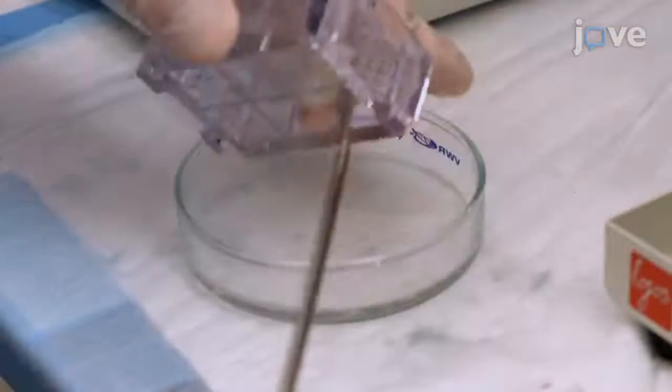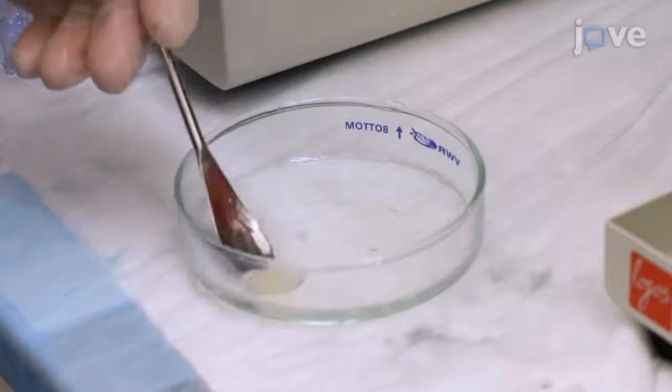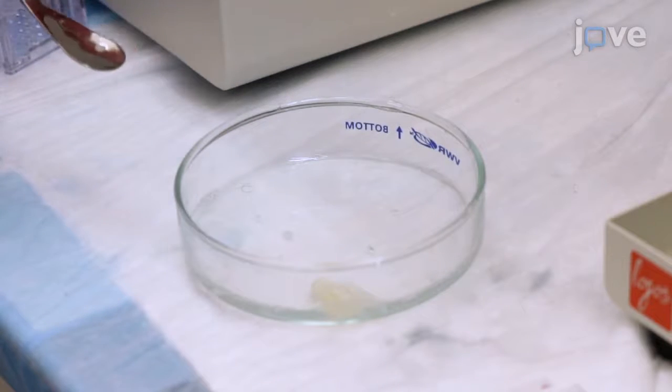Check the sample periodically for sufficient clearing of brain tissue by removing it from the chamber and replacing it in the same orientation.